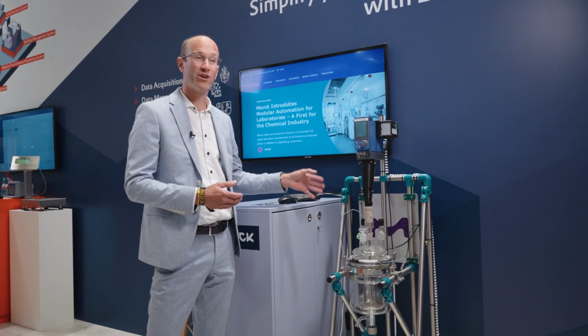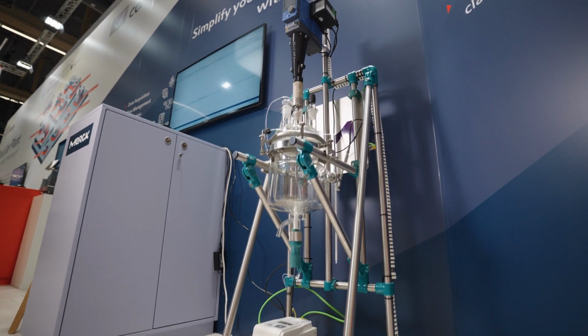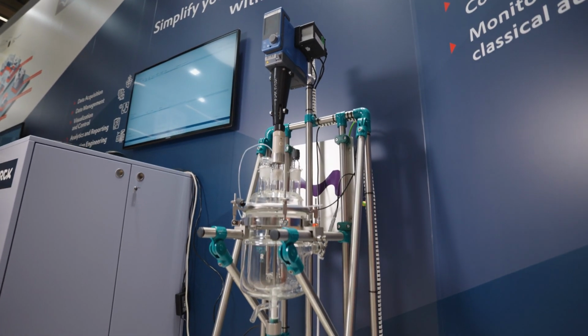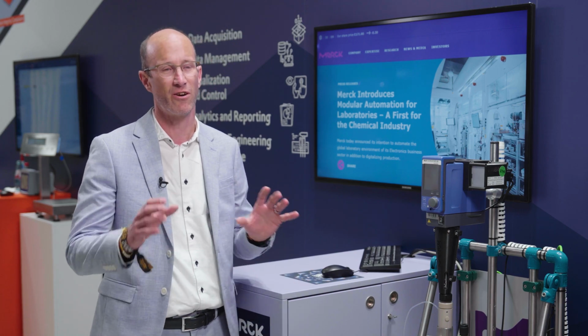So this is one of the first modules you can see here, and it's part of a growing family now in our process development. And we are already expanding this to other, smaller parts in our worldwide network.